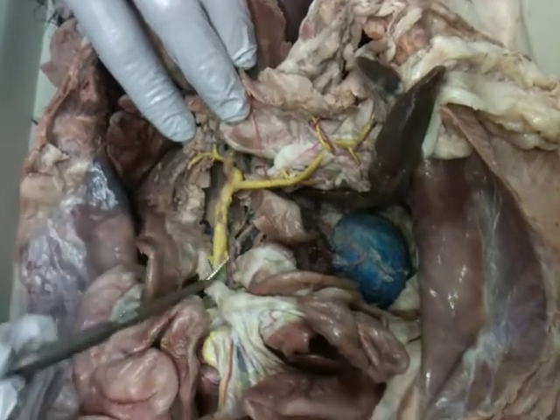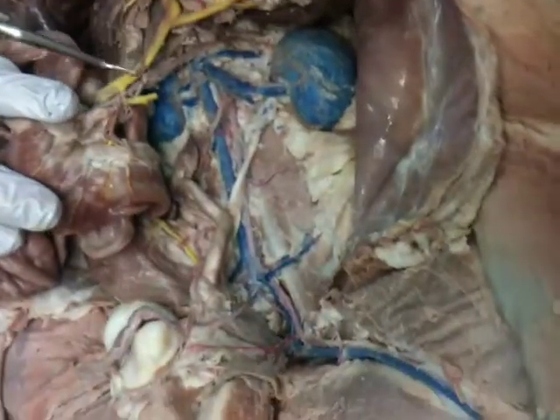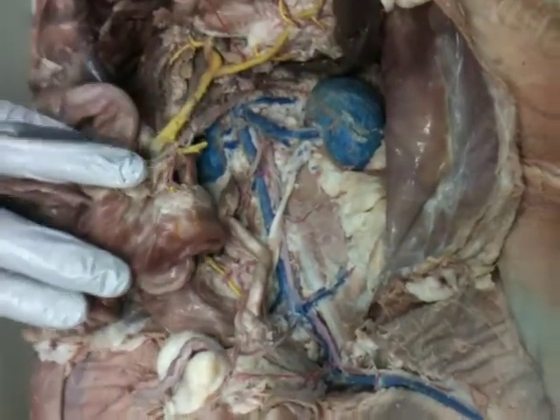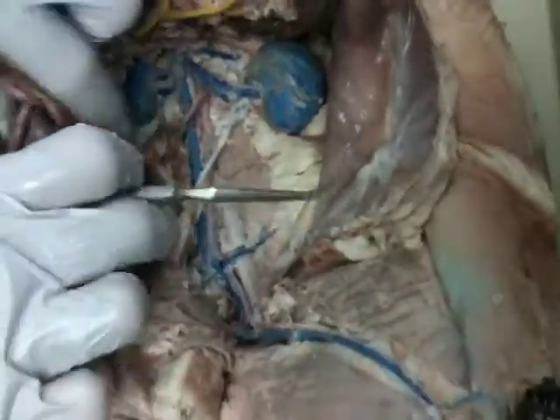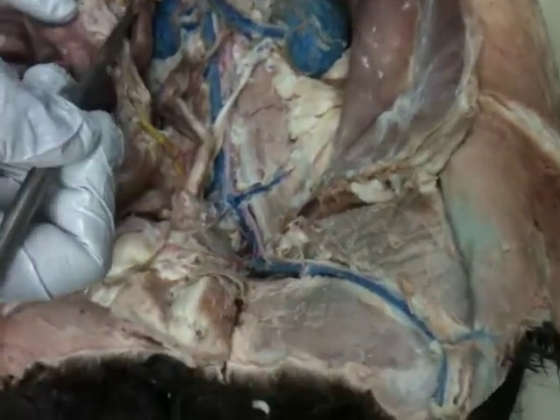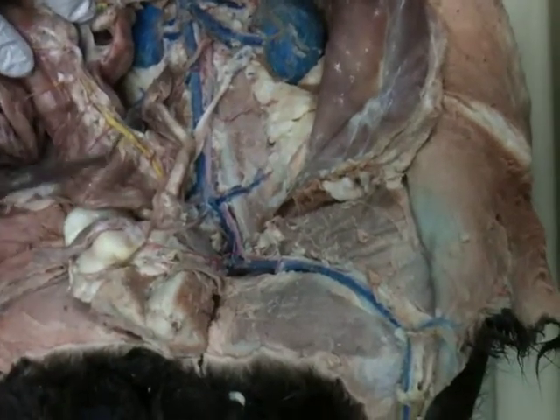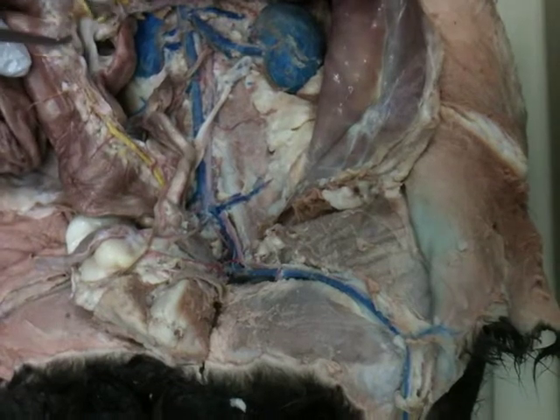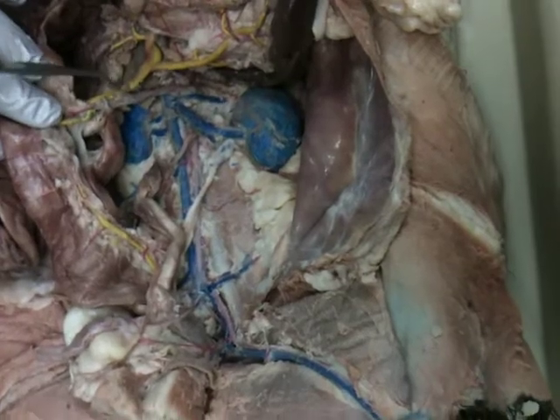Okay. Going on more inferior, we have this guy, which unfortunately has been broken off. We have our superior mesenteric vein, and this is our inferior mesenteric vein. Now that one comes from this guy. It was connected up to this one, but it's been pulled enough that it's been broken off. Remember what that one was? Left colic. Good. So the left colic continues and drains up to here, becomes the inferior mesenteric, goes into the superior mesenteric.